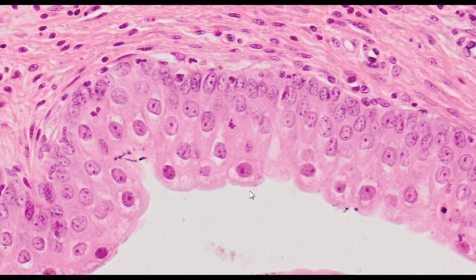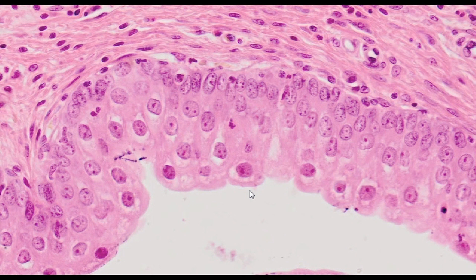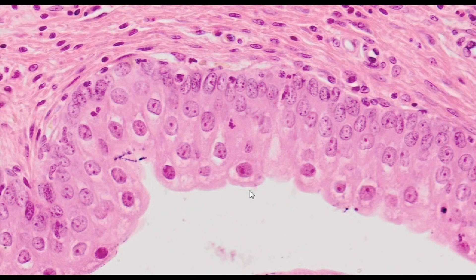Since uroplakins are extremely resistant to various chemical factors that may cause denaturation, the primary function is to protect the urinary tract against the adverse effects of urine.